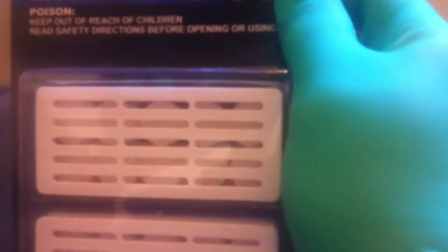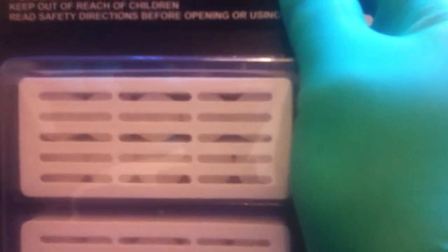Mixed it all up. First I ground these up. Got to be careful when you grind these up because they can become air flammable apparently. They really fluff up — they expand. So it looks like an activated charcoal just by grinding them.